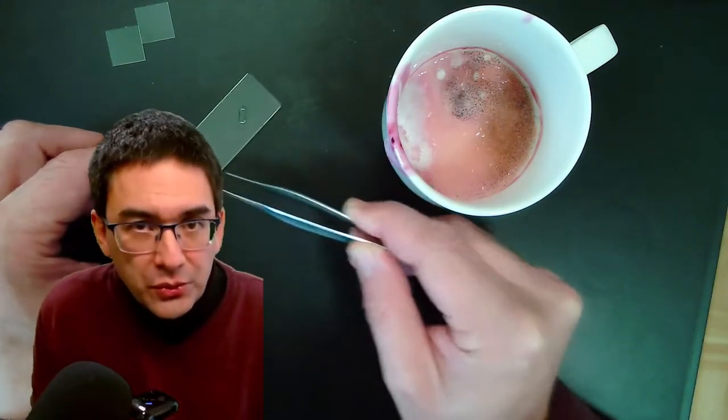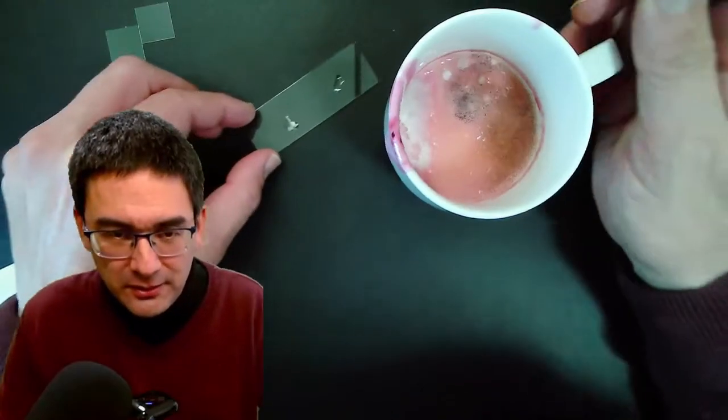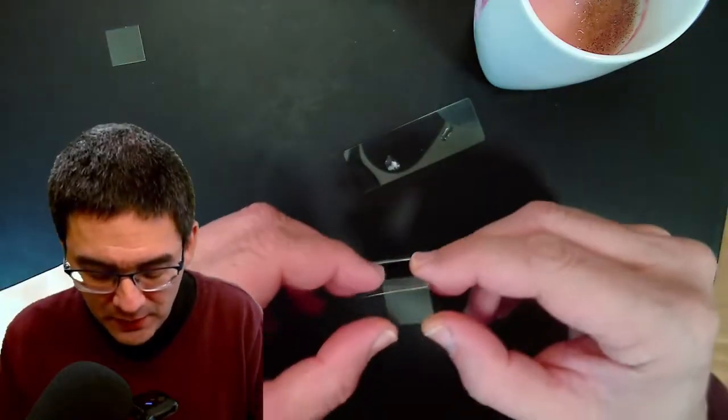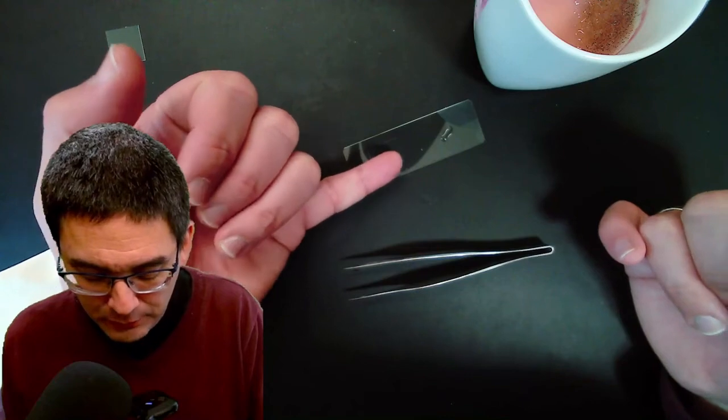And what it does is it grows into the medium to release enzymes and this way they digest the food. So I'm going to put the cover glass on top. I'm going to press down a little bit to make it nice and flat.